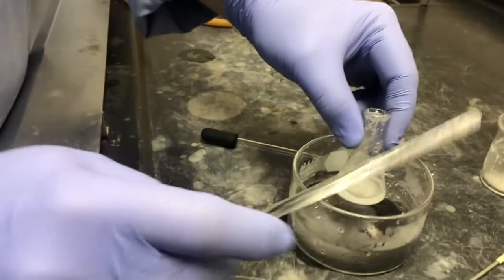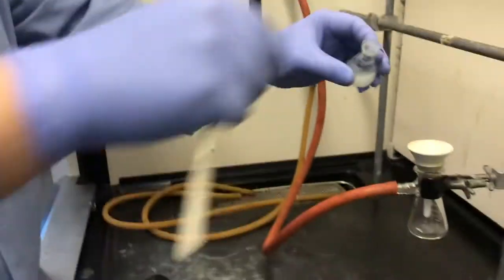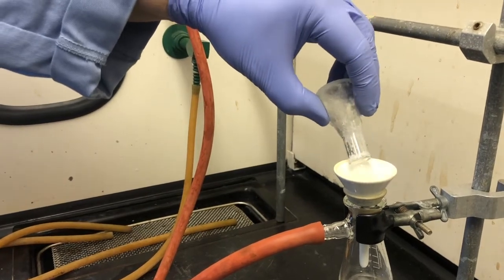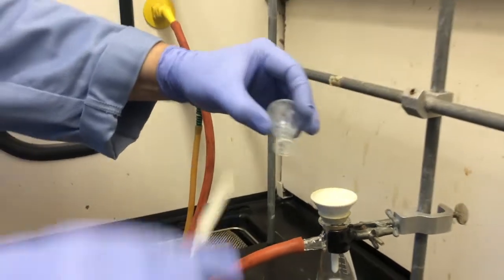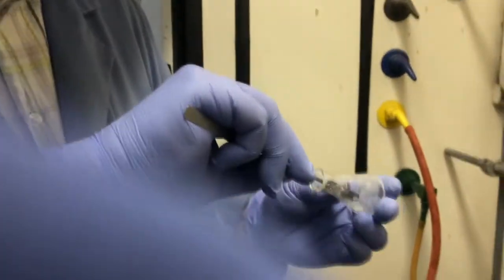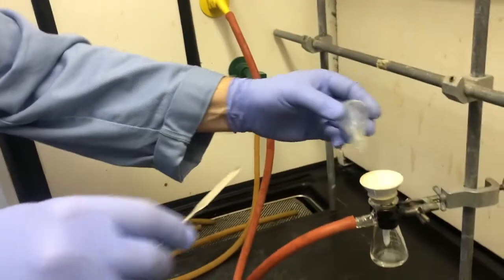Okay, ready? So here you can see after a good long while on the ice, we do have a significant amount of crystals formed. This time I'll clamp the filter flask. I can pour the crystals out and then rinse them out of the flask, whatever's left, with a little more ice cold solvent. It should have been the 1-to-1. It's such a low yield in a microscale experiment. You really have to work hard to get every little piece of solid you can out of that flask.